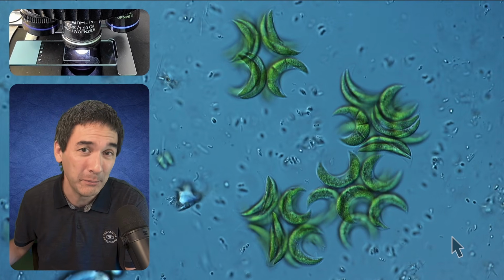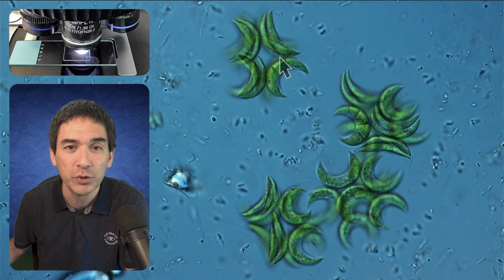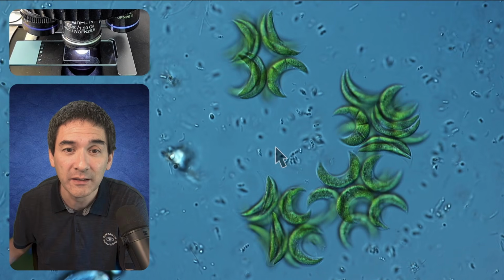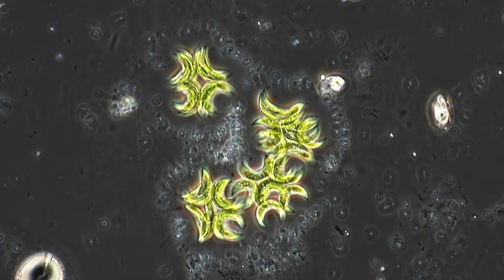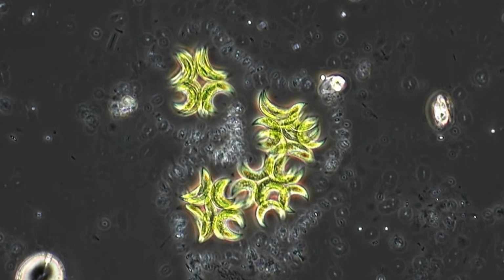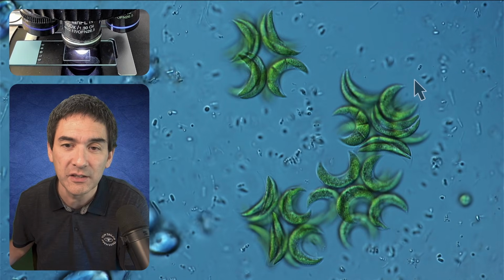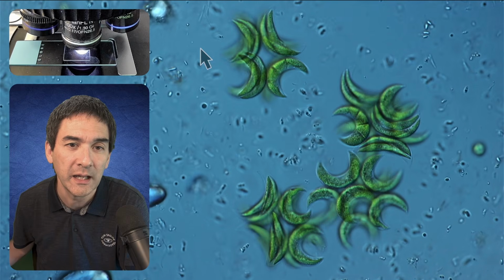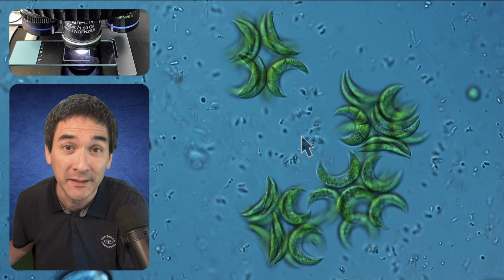Under the microscope, I put a water sample, and what you see over here are those green half-moon-shaped structures. These are algae, and those tiny little things swimming around on the outside are bacteria. Something you can observe quite often is that those bacteria don't like to touch those algae, so they keep a safe distance, and very often you see them form some kind of a line around those algae, and that's referred to as an aerotactic band.